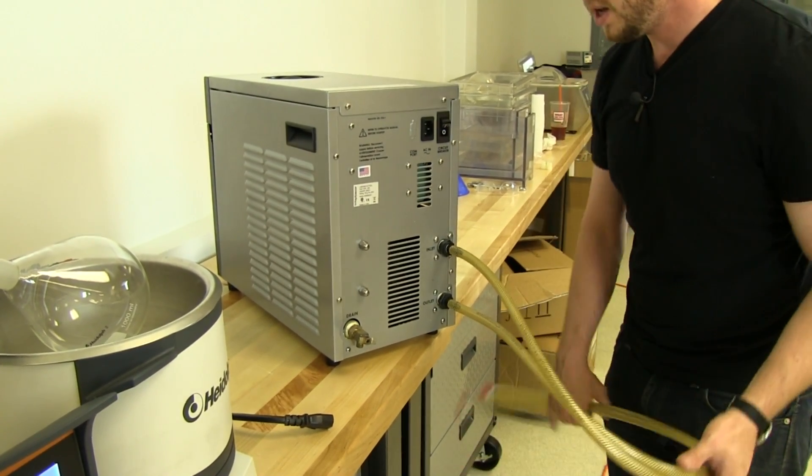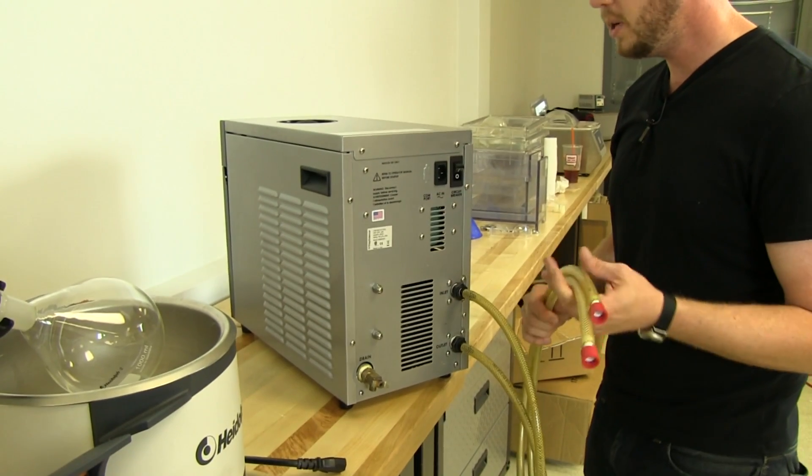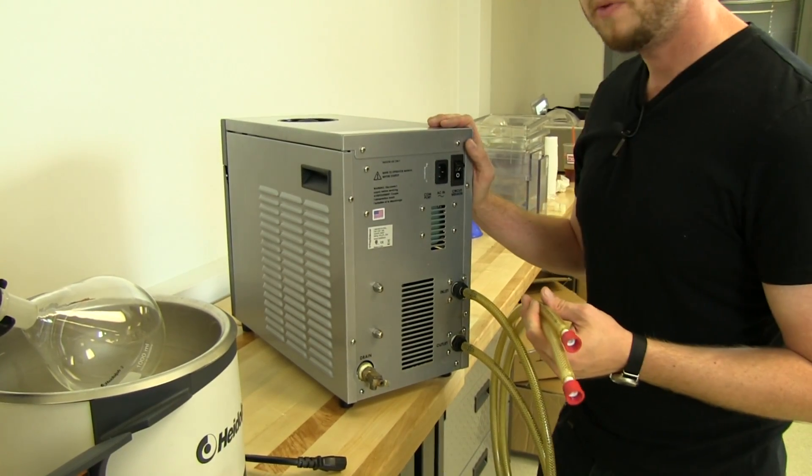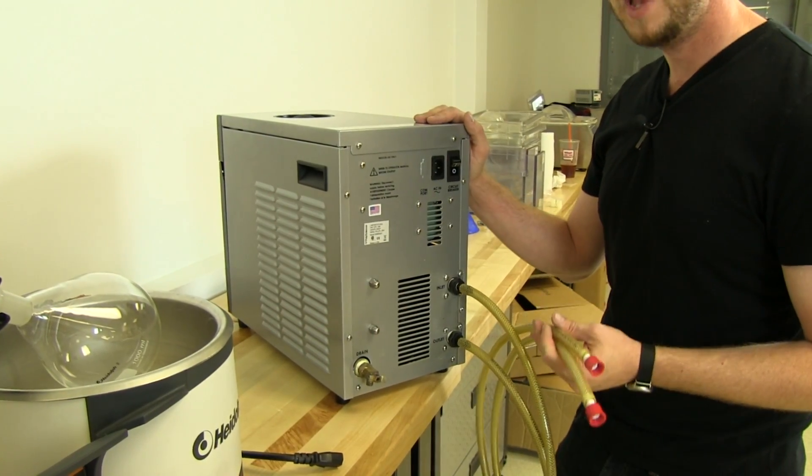We're going to connect these to the glassware, spin this around, and we'll fill it up. We'll show you that in one second.